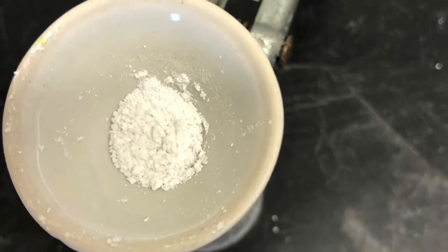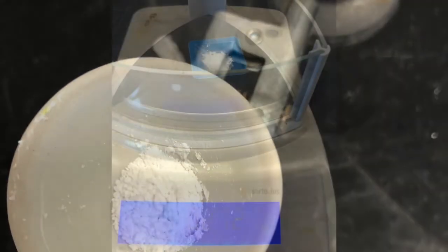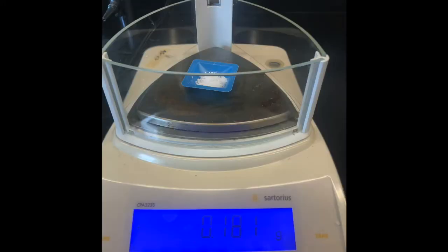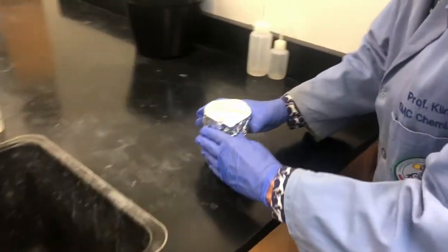After pulling air through the crystals, letting them dry for probably half an hour or so, I took the mass on the pre-tared weighing boat, then let them dry for several days and re-weighed them on the same weighing boat. You can see the mass had reduced as it dried.